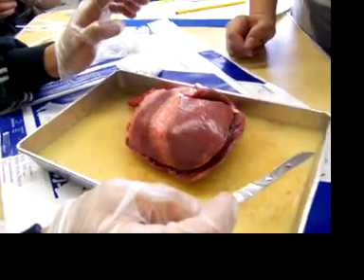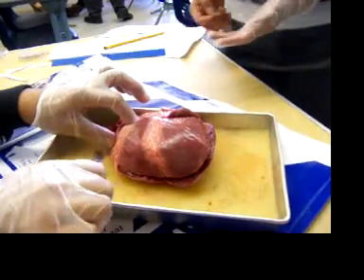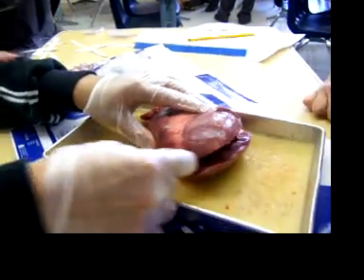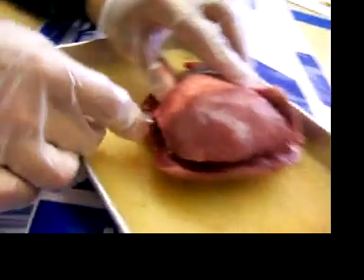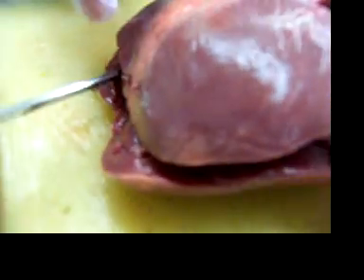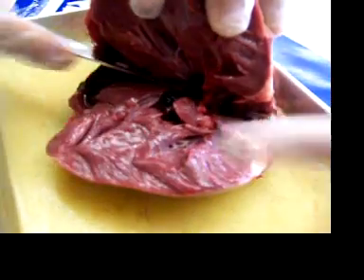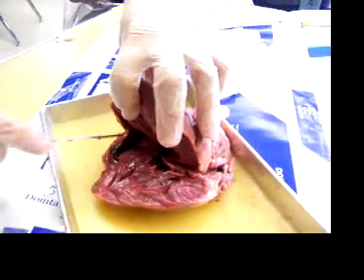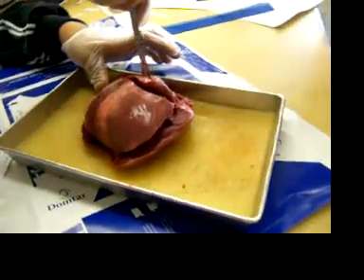Chris, Dan, why is this not cutting open right? Are we doing this right? Can you help us? You said you're supposed to go — cut first from the bottom. Oh actually it says to go from the bottom. That's right. We did it from the top. So I'm just supposed to cut that — it's like a peanut butter and jelly sandwich. Why is our heart so big? Because we wanted a big one. Lift it up. Oh yeah, there. Is this right? Yeah, it is. Is all that congealed stuff blood in there?